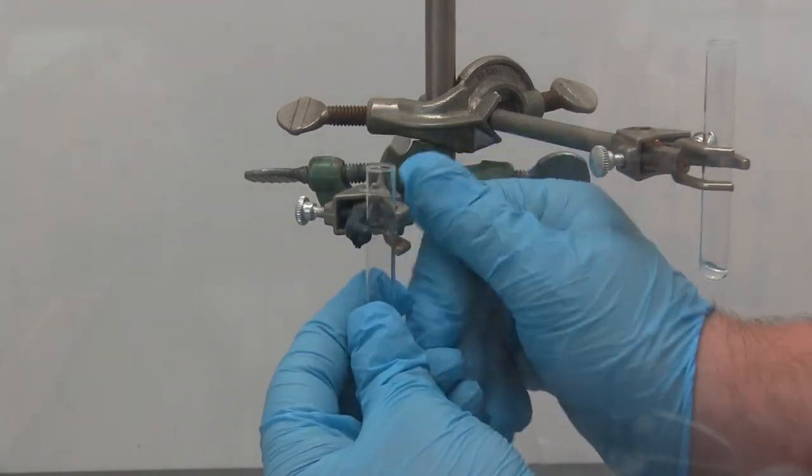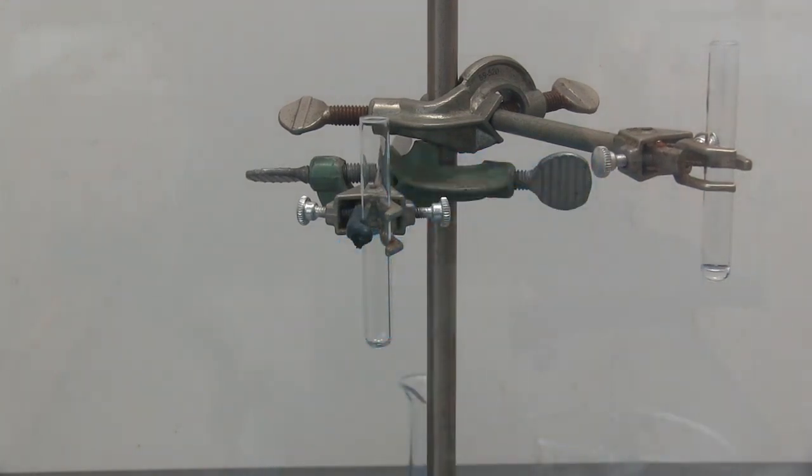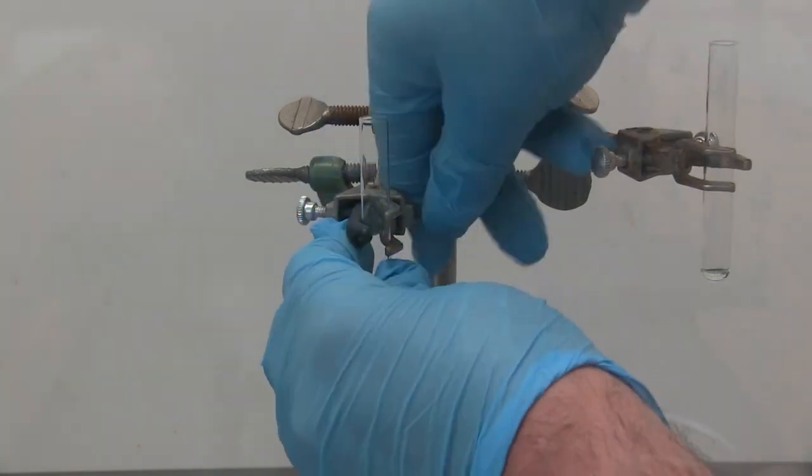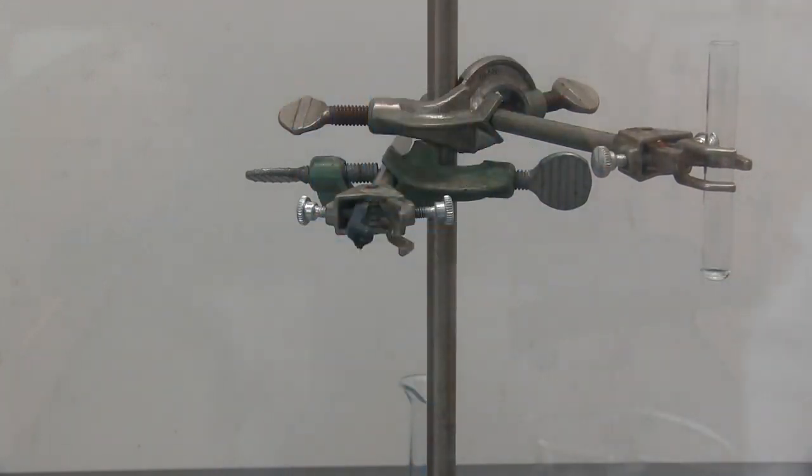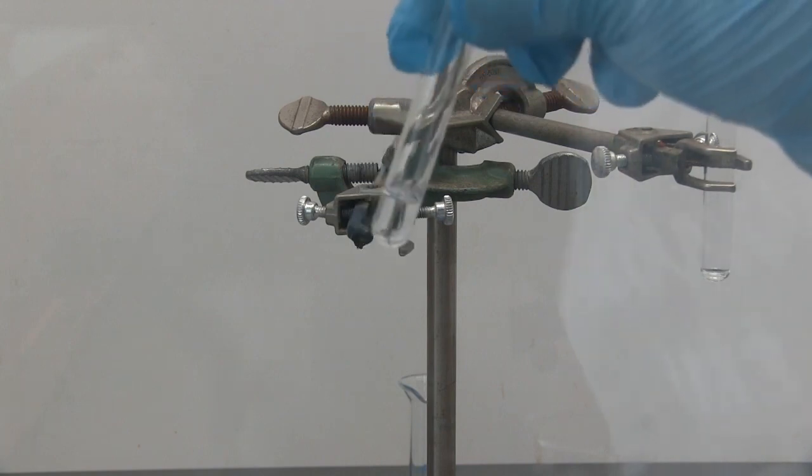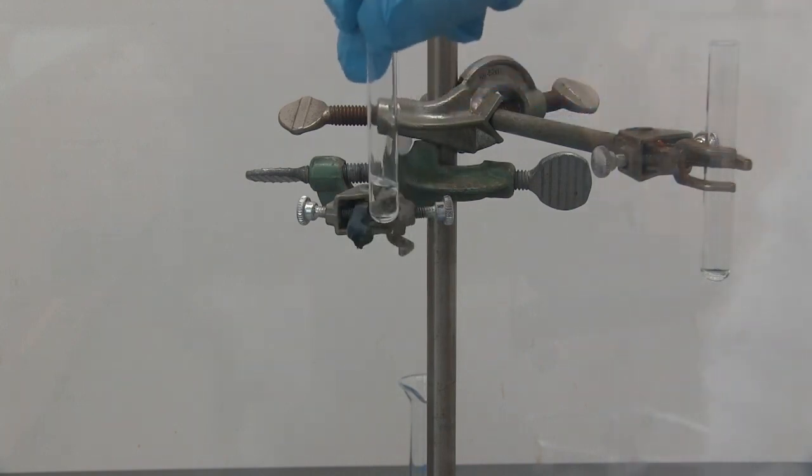I'll try the bromine test one more time. It's a really light color on the bromine. It's supposed to go from an orange to a clear, but since we have so little bromine, it's a yellowish color. Here is the bromine solution. It does have that slight yellow to it, so we'll have to pay close attention to see if there is a color change to clear. It does look like there's a little bit of color change. It's hard to tell on this one. Let's shake it up and see if we still see any yellow. I'm not seeing any yellow. So it's gone from a very, very light yellow to a clear solution.